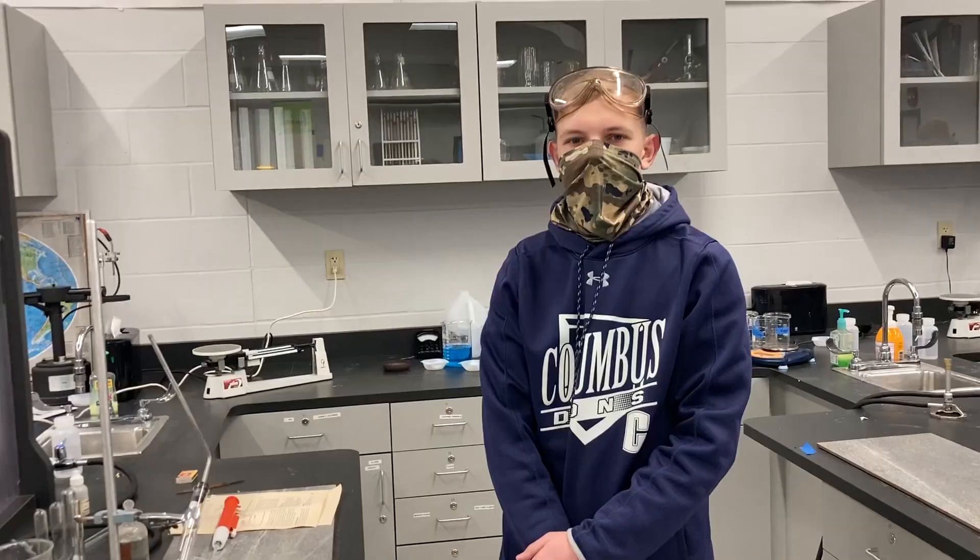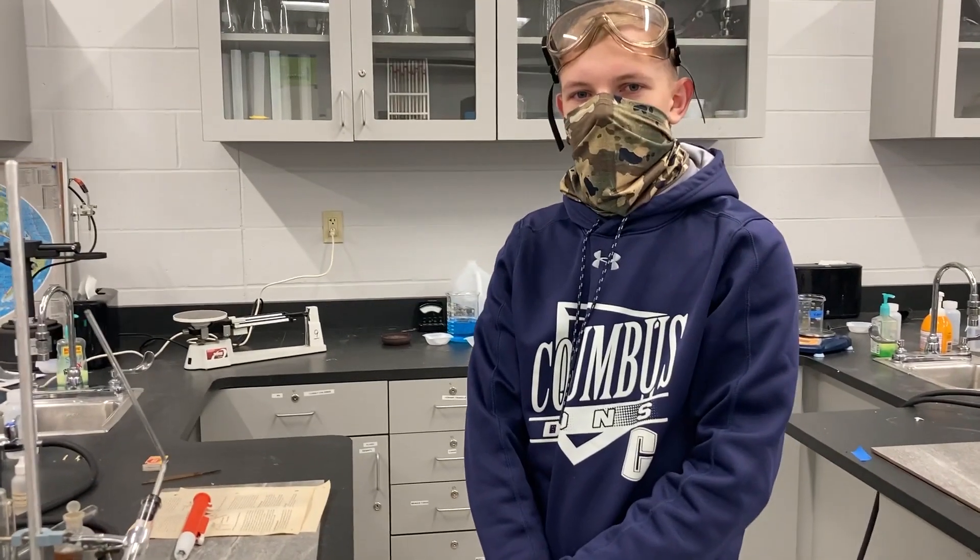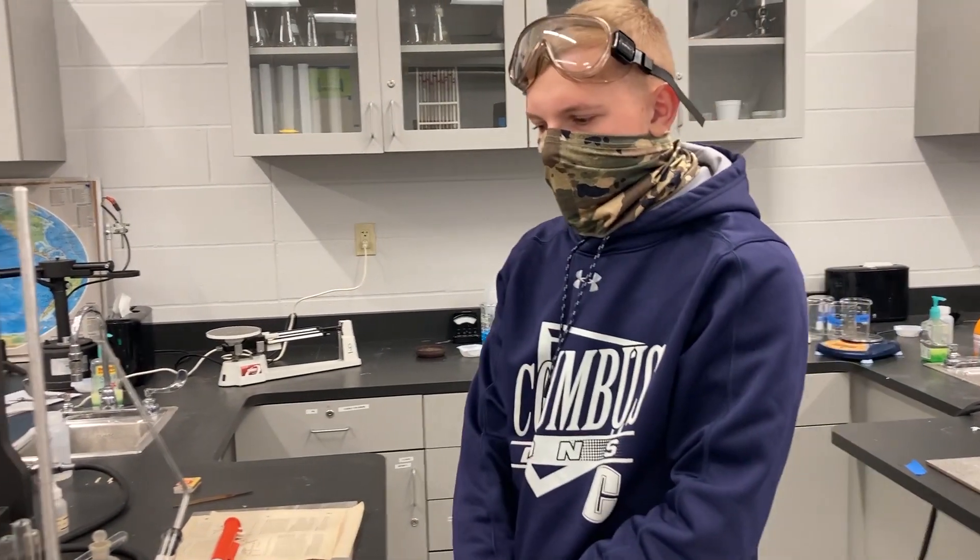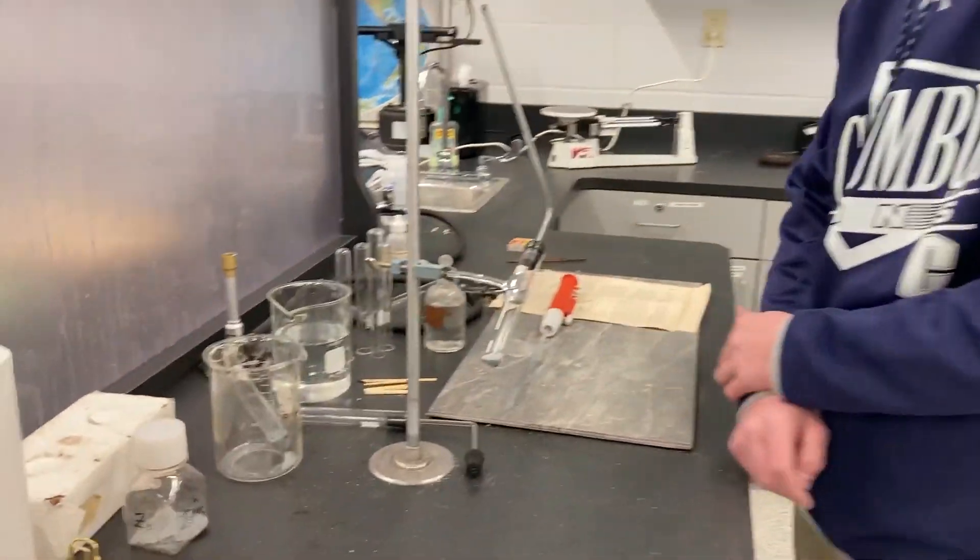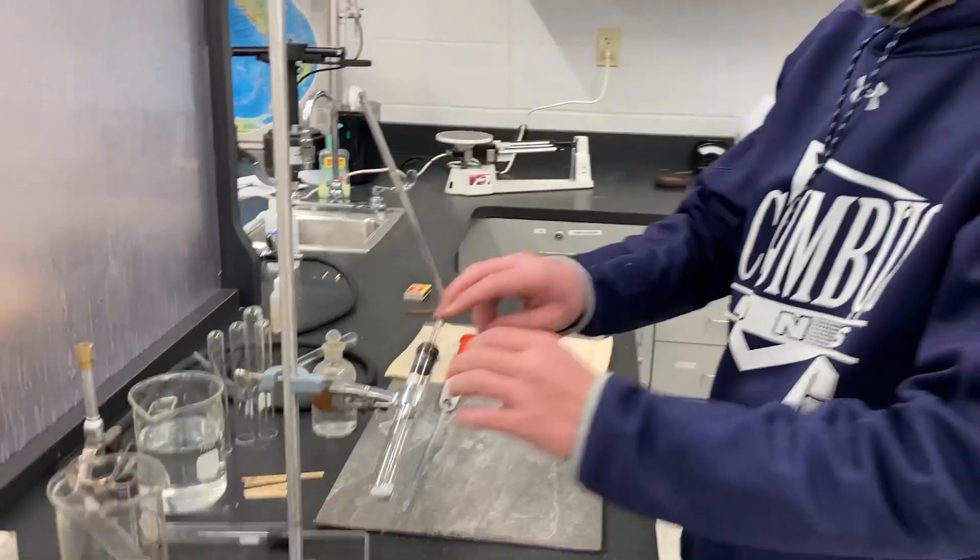I would like to introduce you to a student of mine who's working on a chemical reaction. Hi, my name is Brendan Schneider and I'm a sophomore at Columbus Catholic High School. Today I'll be showing you an experiment where I mix zinc and hydrochloric acid which will create a chemical reaction creating a flammable gas.